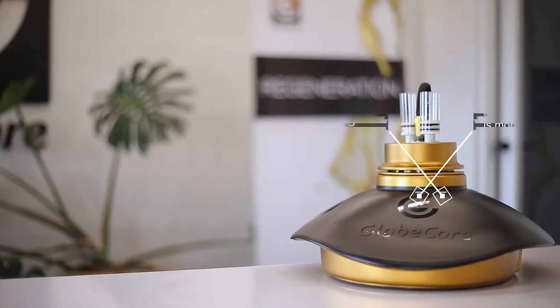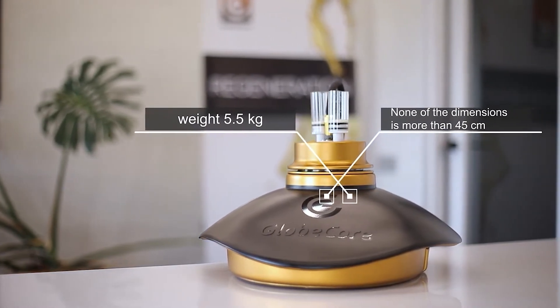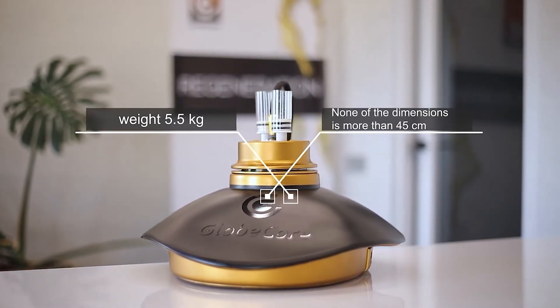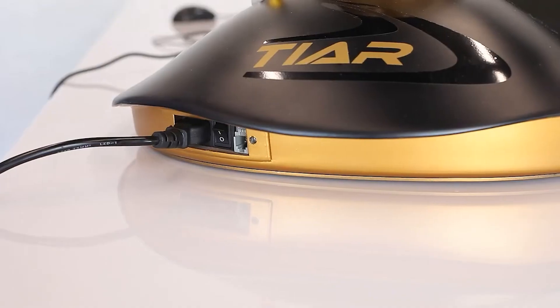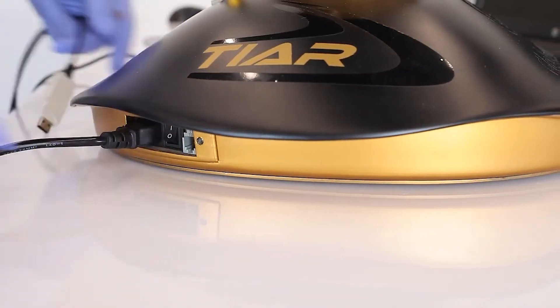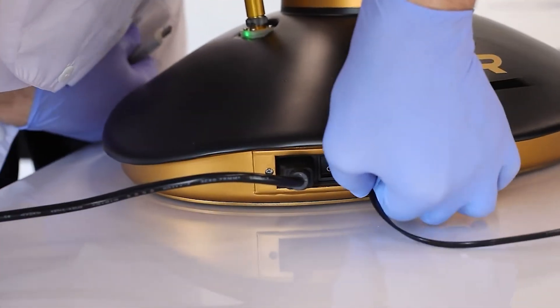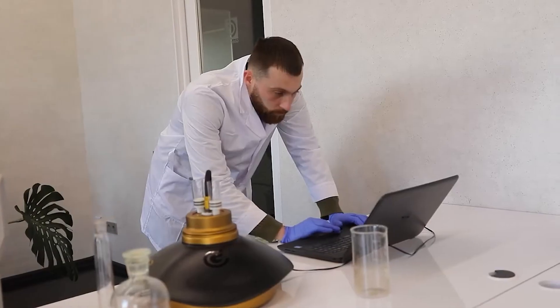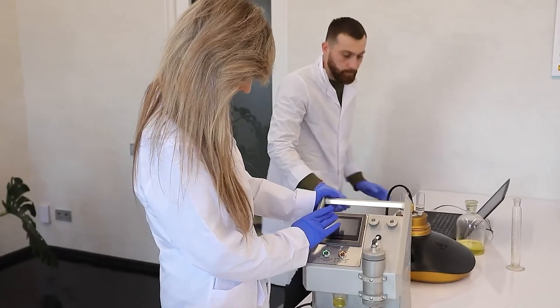None of the dimensions of the TOR-3 unit exceeds 45 cm, and it only weighs 5.5 kg. The unit is equipped with a microprocessor, a digital-to-analog converter, and a high-voltage amplifier, which allows generating a test signal of the desired shape and operation in a wide range of amplitudes. Therefore, TOR-3 is quite versatile and can be used to measure the dielectric loss tangent according to different test voltage standards.